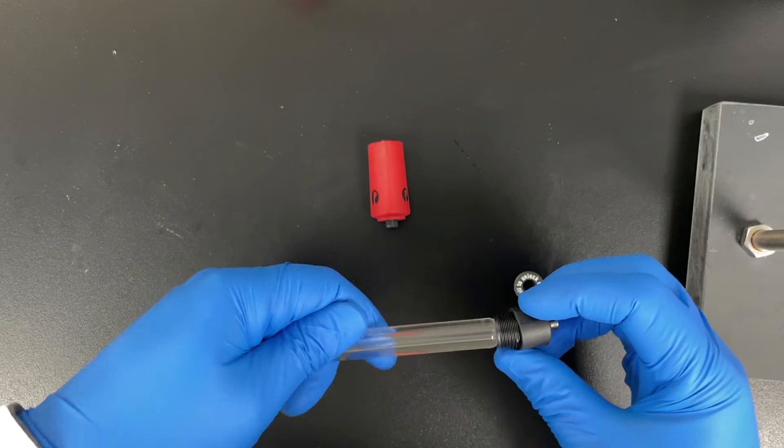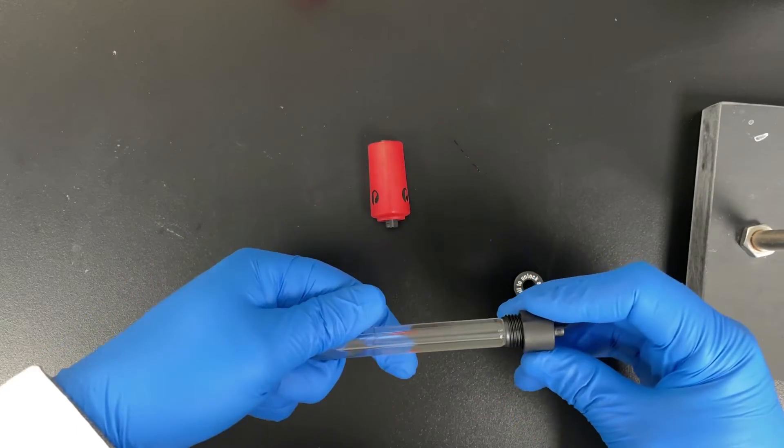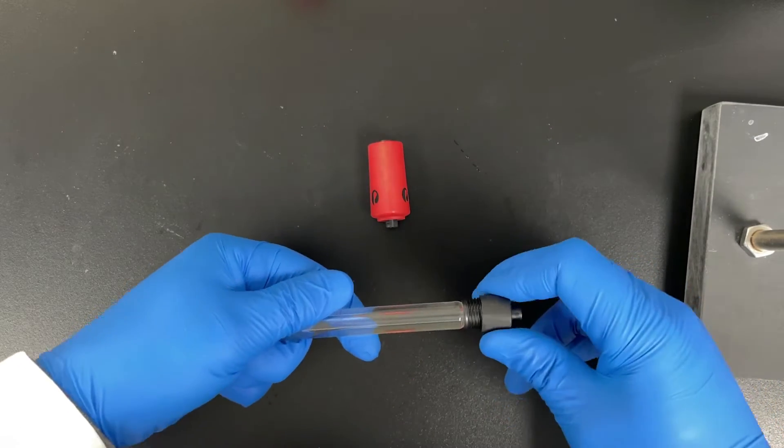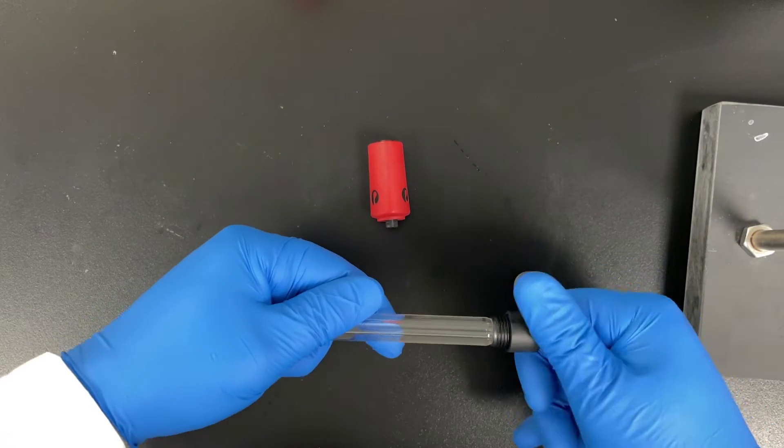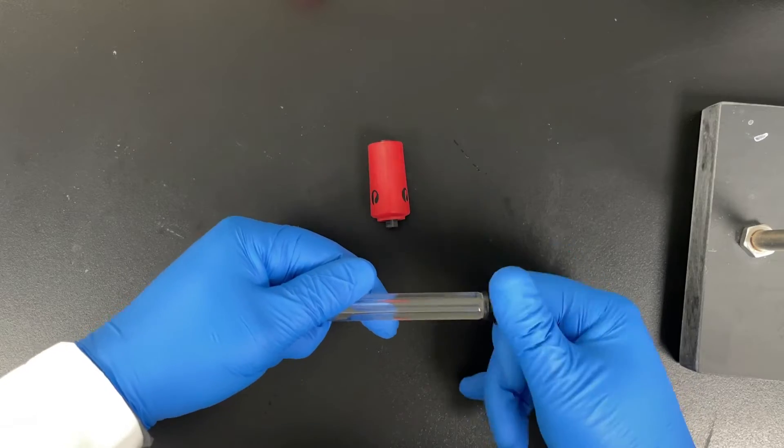Now one of the things I didn't do here was there's a tab on the bottom adapter that you're supposed to line up, and that's why I'm having such a hard time screwing down the cap. I did come back later and fix it.